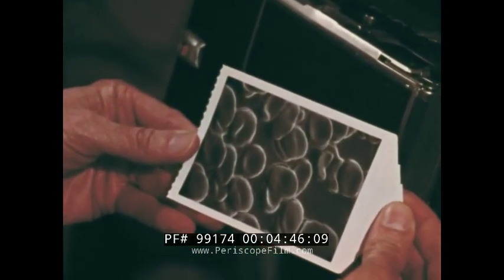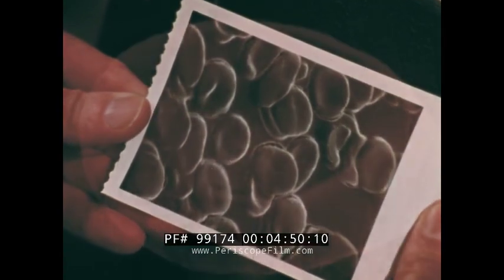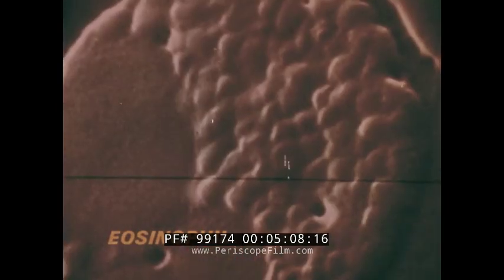The form of the normal red blood cell is quite stable, and this biconcave pseudo-donut is probably much like the shape of the cell in the human bloodstream. The same is not quite true for more fragile specimens, like the eosinophil, where the original shape has been flattened out by drying in the air. But when the membrane shrinks, we can see the granules inside, as here from a patient with leukemia.